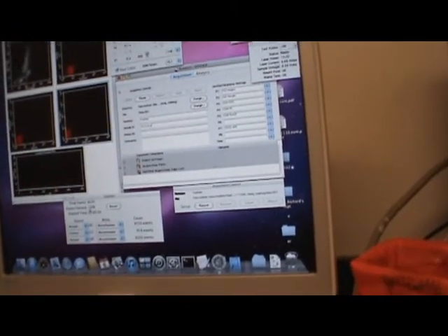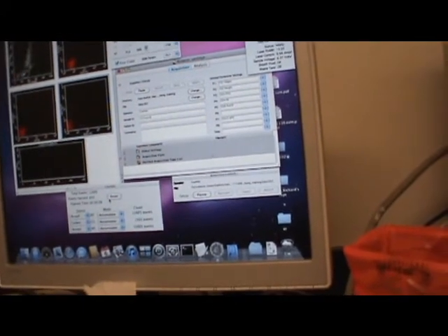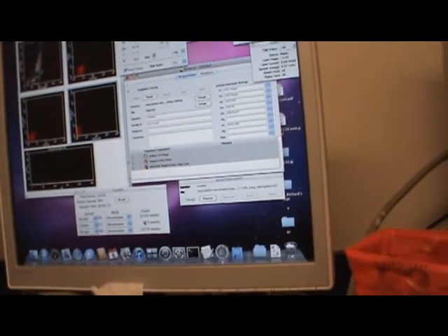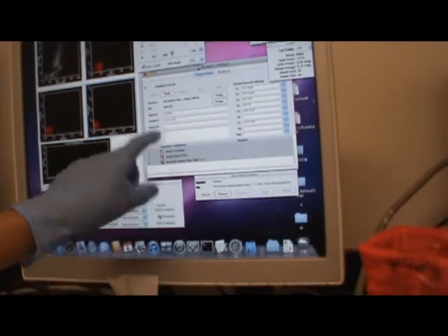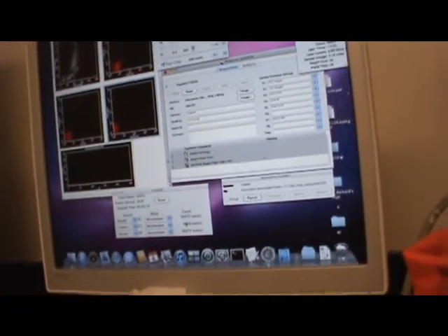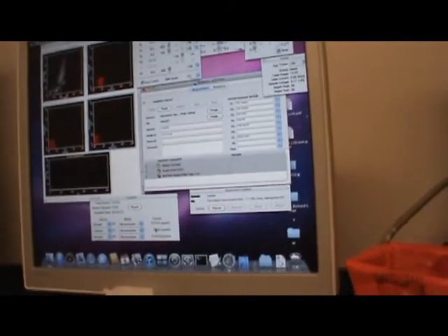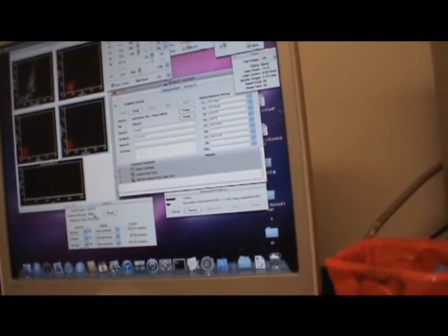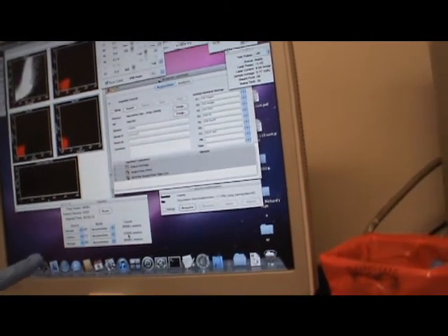Can you change the file name, say unstained.11? Yeah, anything you can just change. Once it reaches 10,000 events, now I can put it on high. Once it reaches 10,000 in this gate, it should automatically stop, because we have already given the command to stop. Otherwise it keeps going. It's telling you events per second. A lot of cells. And see, now it should stop. It's done.